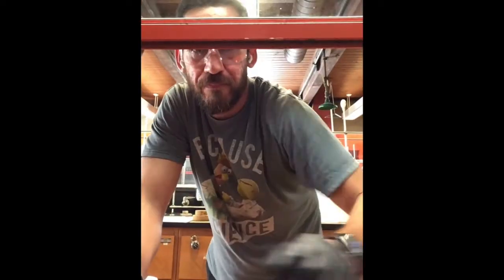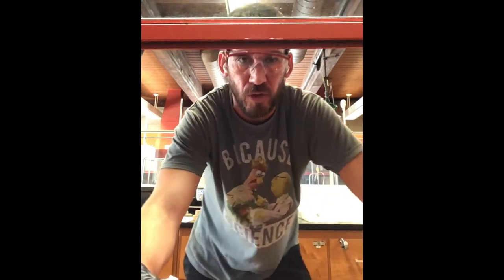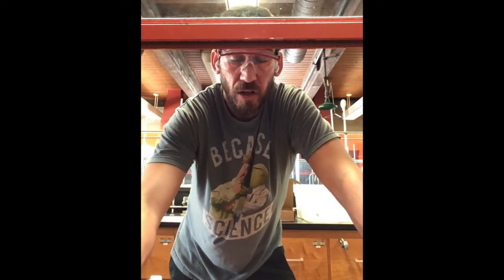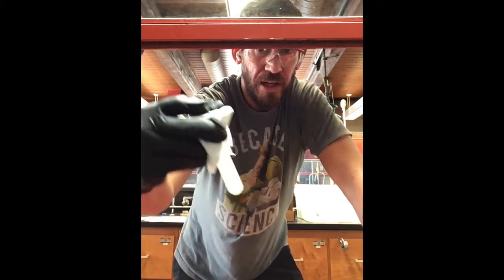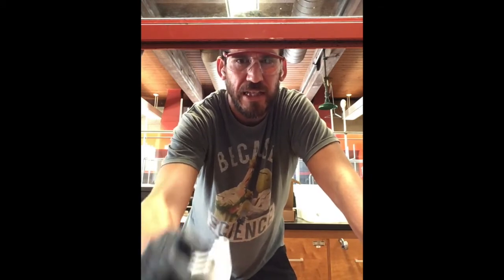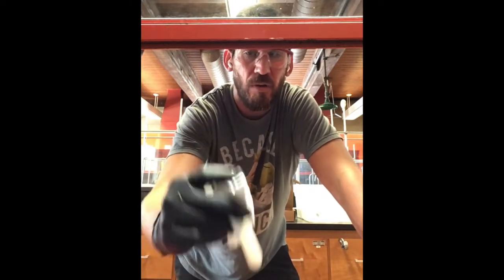to separate. Okay, so just to observe what an emulsion looks like, what I want to do is shake this up for you to create an emulsion, and then I'll pour it into a glass test tube, and then you get to see what an emulsion is and what I mean by that. And you'll also see more or less how quickly it does not separate into 2 layers. So here we go. I put a little paper towel around here just as a secondary backup for if the lid were to fail or if there's any leakage. I don't want any on me, because these gloves are not necessarily perfect. Even chemicals can go through them. It just gives us more time to take off the glove and protect ourselves.